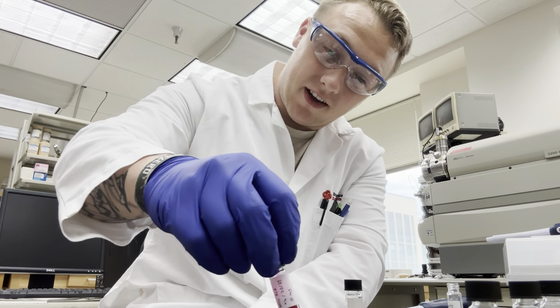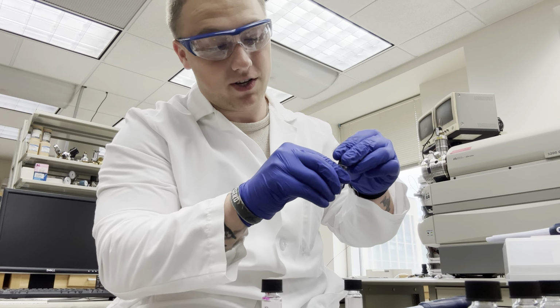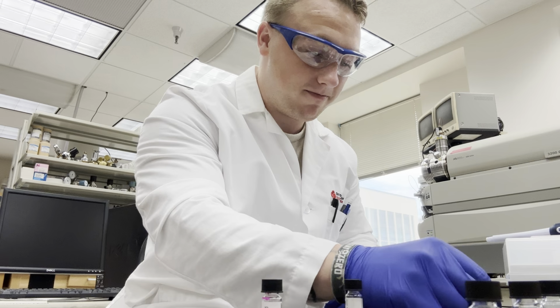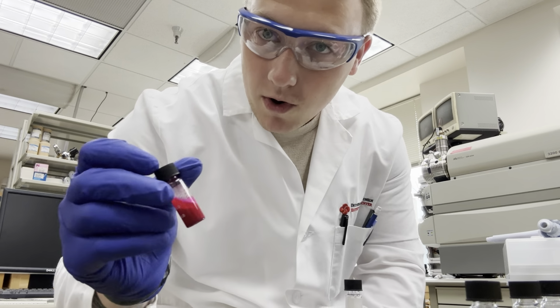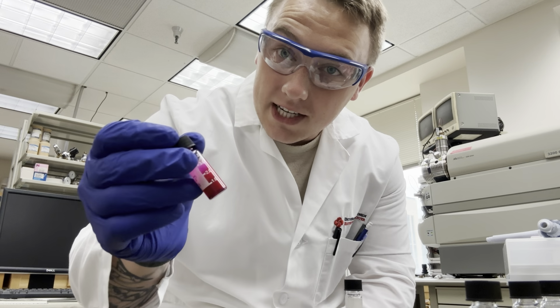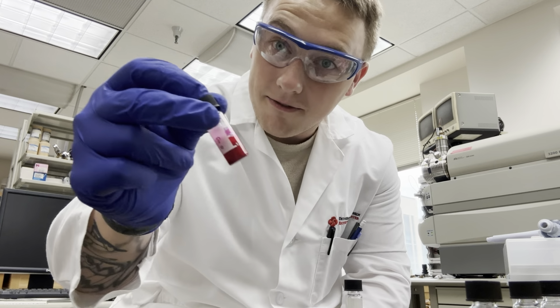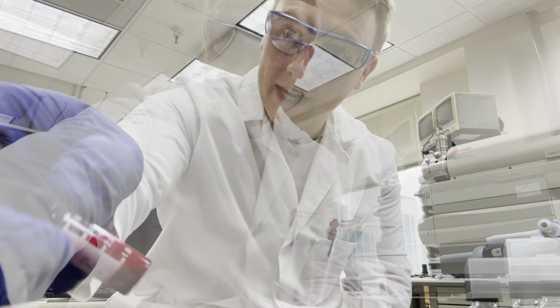That's Nile red dye. Make sure we cap our DMSO solvent, because we're going to be using that again shortly for our 1 milligram per milliliter concentration. And now what we're going to want to do is go take this to a vortex machine, and we're going to mix it up and make sure that all of the stuff we've weighed out is effectively dissolved in our solvent. So we're going to go vortex that and be right back.